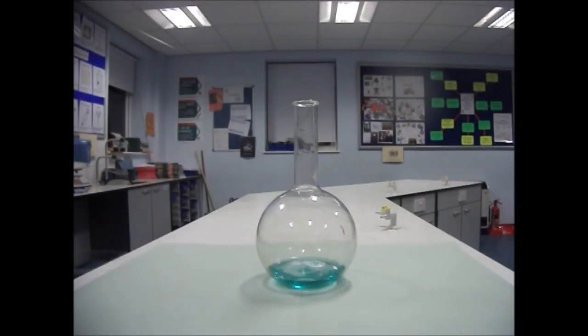I'm now going to demonstrate the Elephant's Toothpaste Reaction, which is a catalytic breakdown of hydrogen peroxide into water and oxygen.